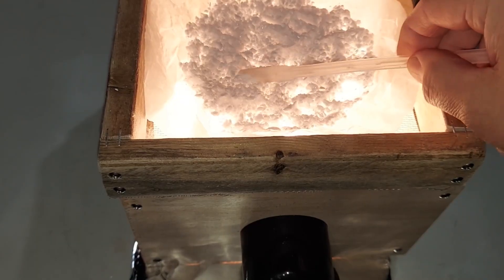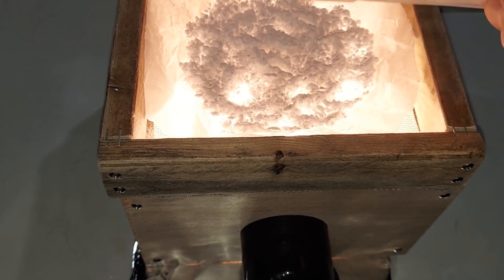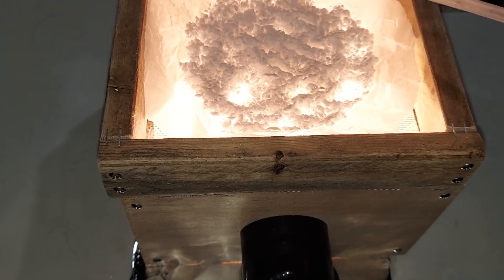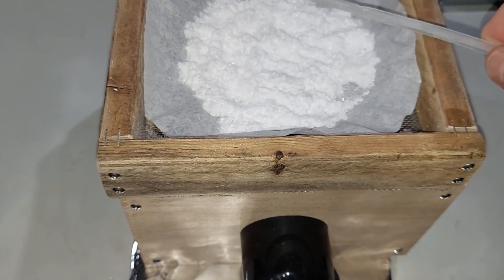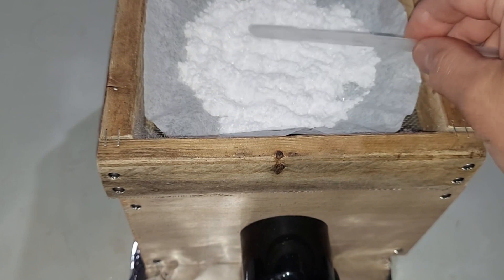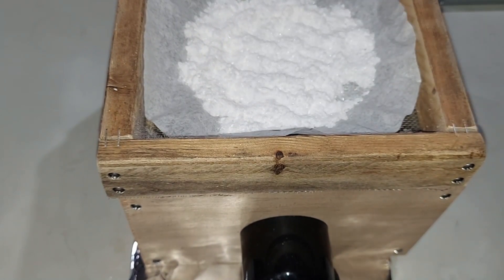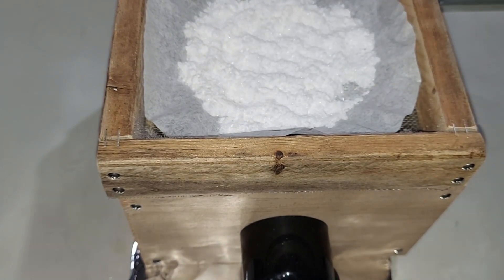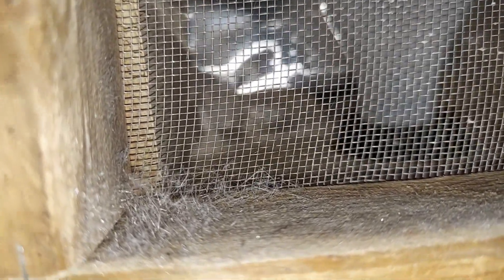This has turned into a powder — it's really dry. Salicylic acid does sublimate if you heat it too long, and there's some evidence of that right there.